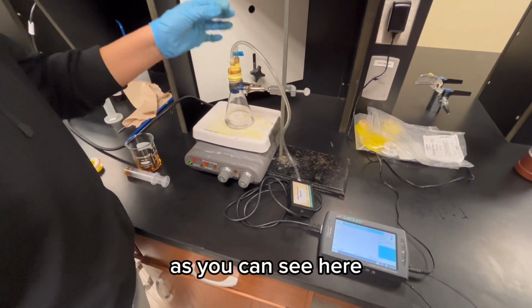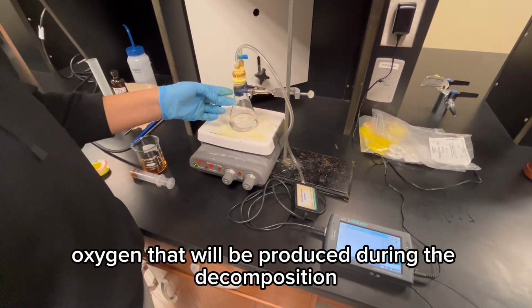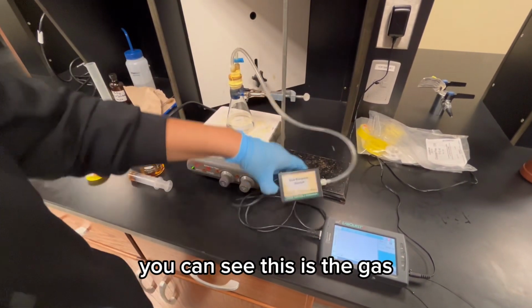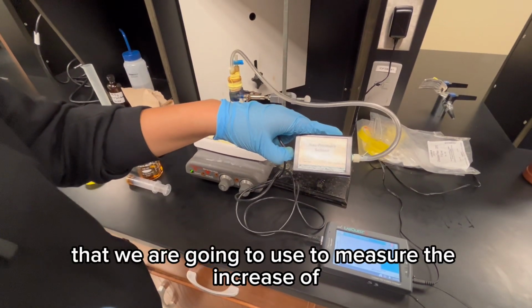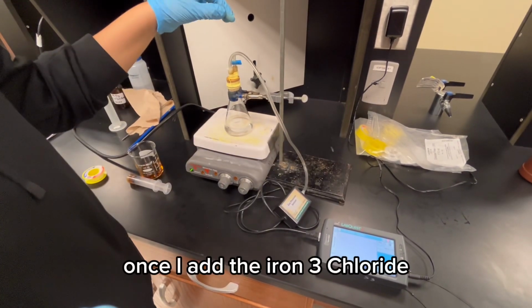As you can see here, the stopper connectors are tightly secured to the stopper so that all the oxygen that will be produced during the decomposition reaction will not escape the flask, creating pressure. Here you can see this is the gas pressure sensor that we are going to use to measure the increase of pressure during the reaction once I add the iron 3 chloride.